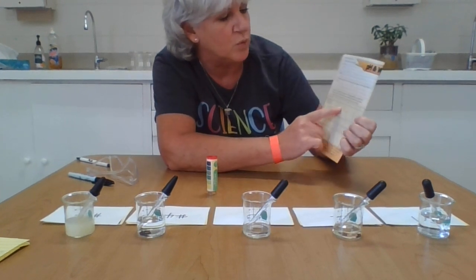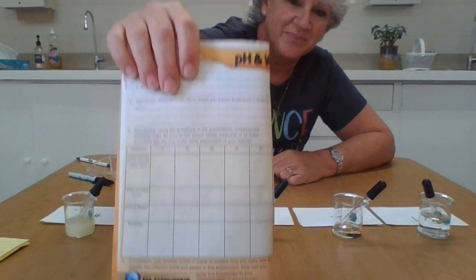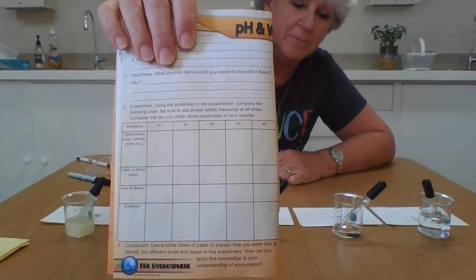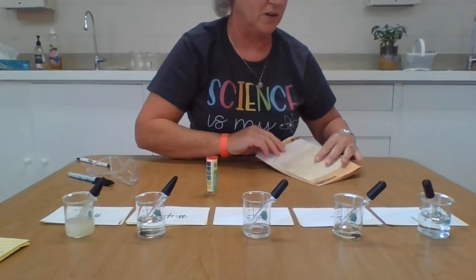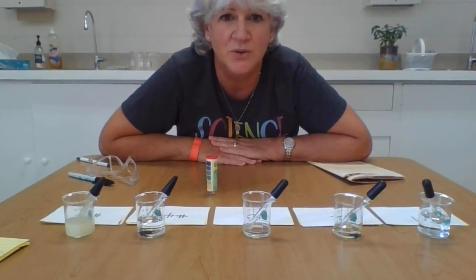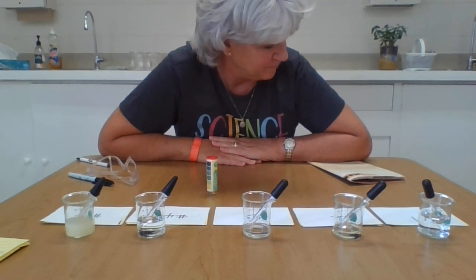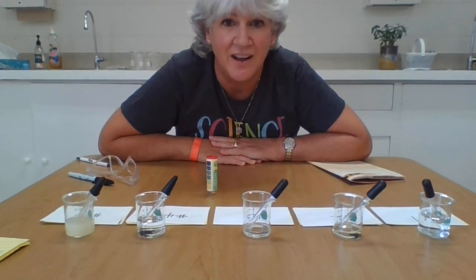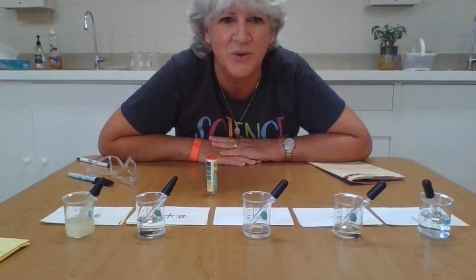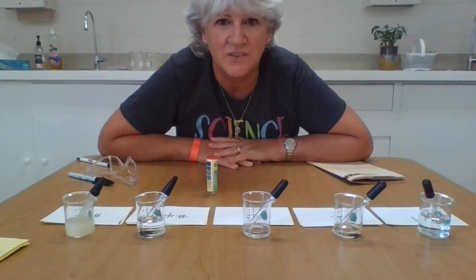You can see it's numbered 1 through 5. It goes through all of the criteria that we're going to look at today. I have my substances numbered as well. So you're going to be a detective with me. I'm going to give you the description of the items, since you're not here to describe them yourselves. Normally this is something we would do together in class, but unfortunately with the virus, virtual is our only option.